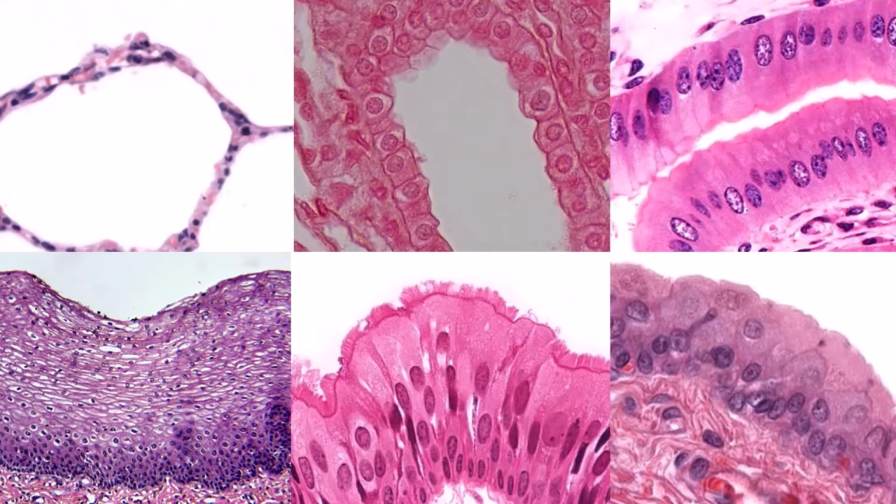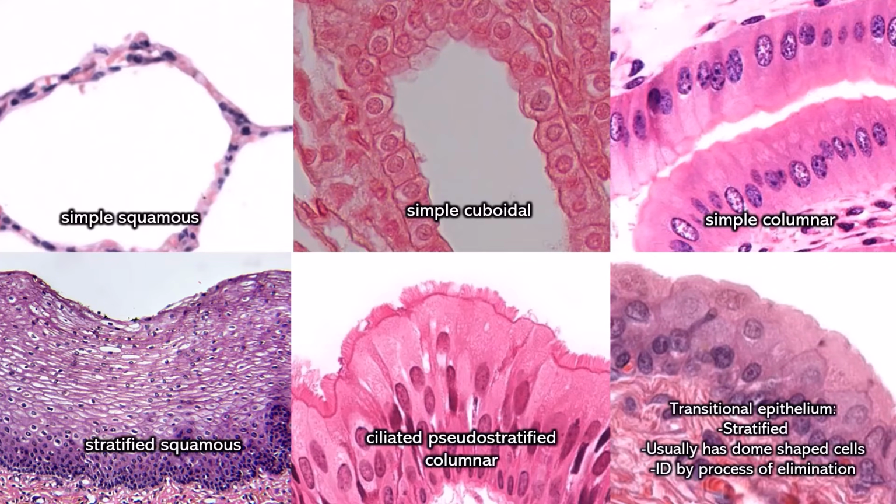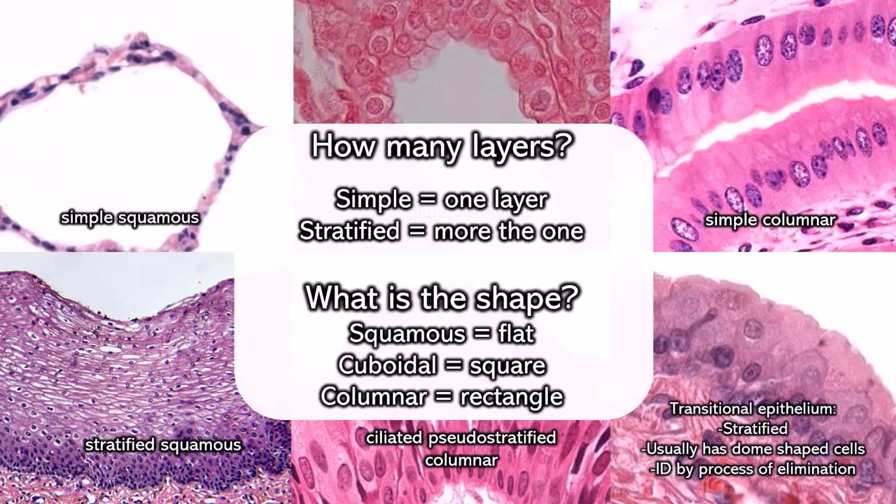To help you get a baseline idea of what you know versus what you don't know, I want you to pause the video and see how many of these 6 epithelium you can identify before I say anything. Remember, when you're thinking about epithelium, you should ask yourself how many layers and what is the shape, because that's either going to give you the name or give you enough information to tell it apart from the others.